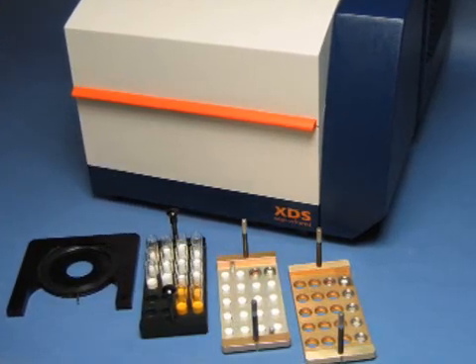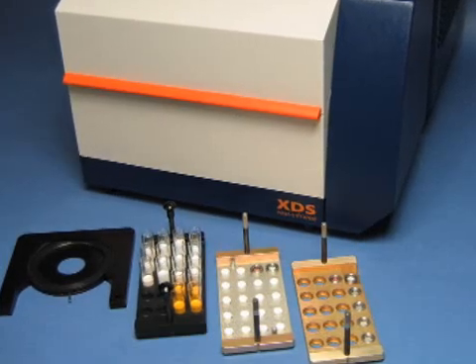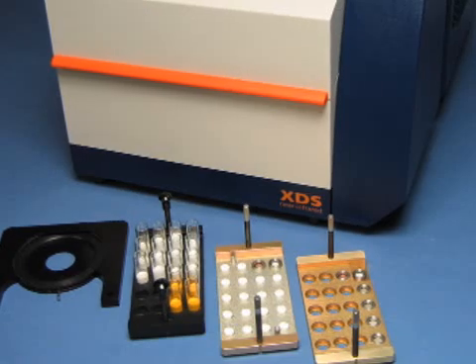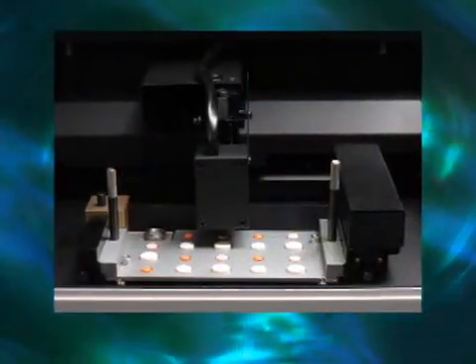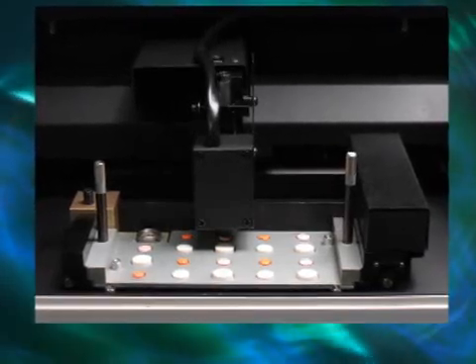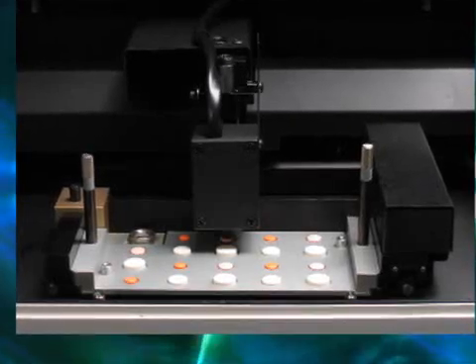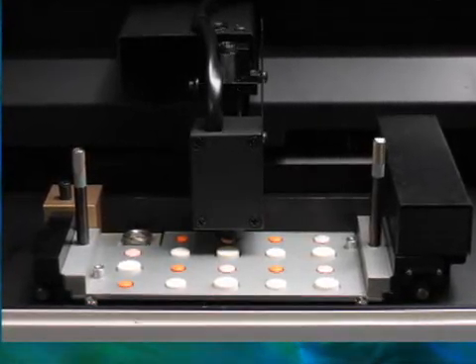The XDS Master Lab offers pharmaceutical manufacturers a fast and reliable test method covering the full array of solid dosage forms. The versatile sampling mechanism makes it possible to automatically measure multiple tablets in transmission or reflectance mode, or multiple vials in reflectance mode.